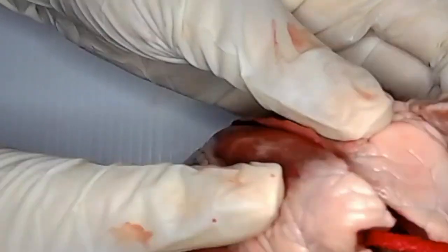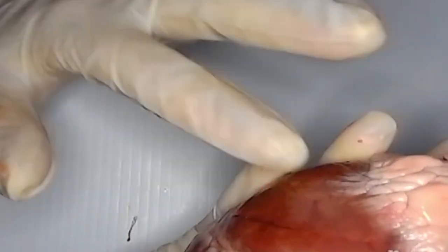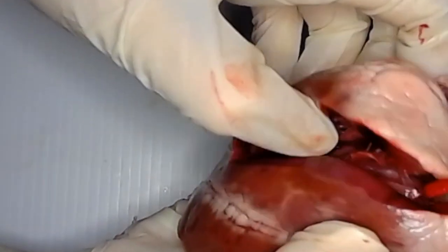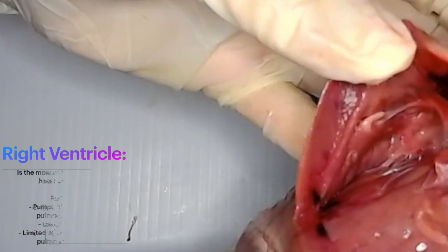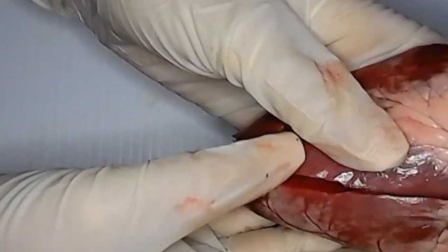Okay, let's have a look at the right side of the heart. So you can see that it's a little bit smaller, and the reason for this is because it doesn't need to pump the blood as far, so it doesn't need as much wall on the outside of the heart. I've made an incision on the right ventricle, which I'm going to open up. Again, you can see it's a lot smaller than this one here.